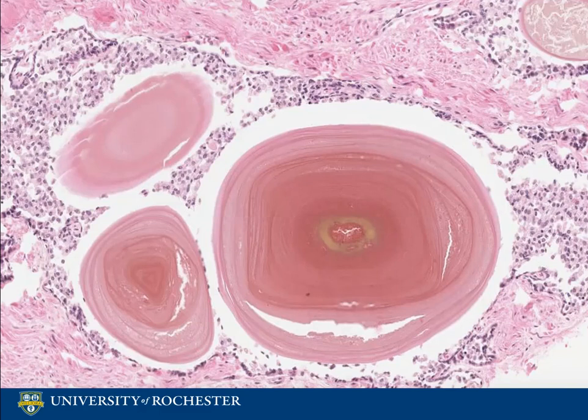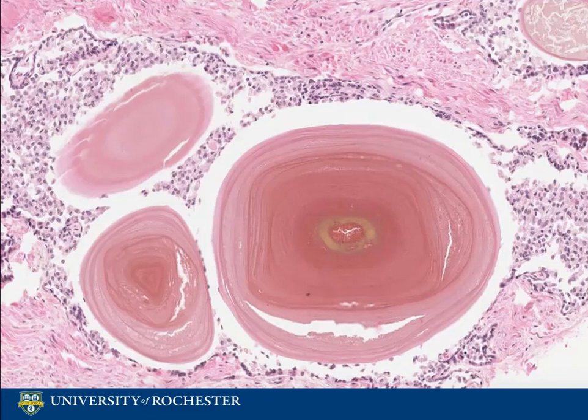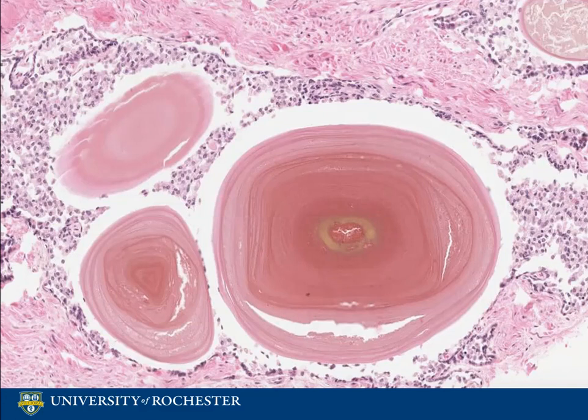As mentioned before, prostatic glands produce intraluminal secretions. Sometimes these secretions can calcify into concretions called corpora amylacea, as you can see in slide 147. These concretions are completely normal in the prostate gland and increase in frequency with age.